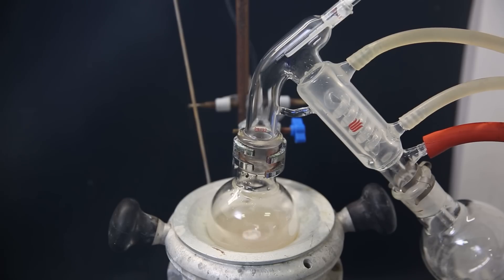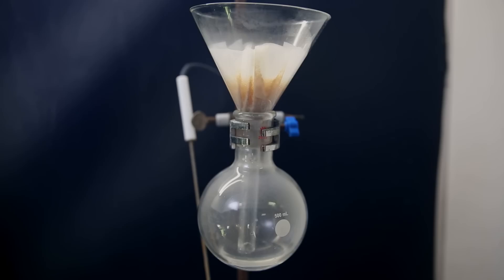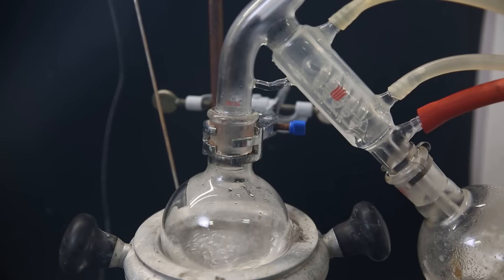So instead, I just heated it to its boiling point and then filtered it all through a paper filter with regular gravity filtration. I washed it down with a bunch more boiling hot water because the solubility of carboplatin is quite low. I then took the filtrate and distilled off all of the water.